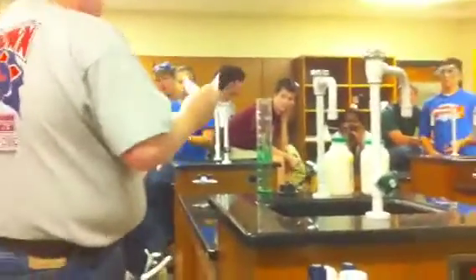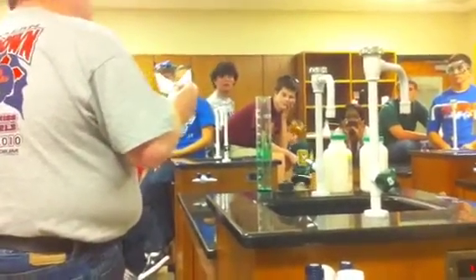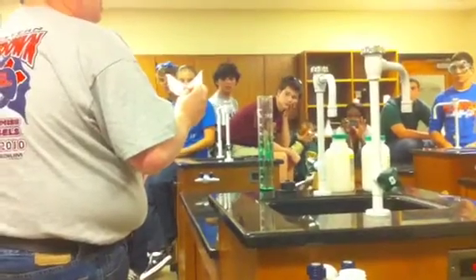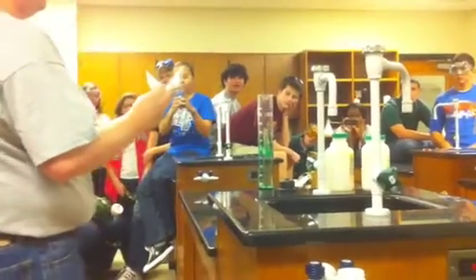We use 3% hydrogen peroxide for cuts — the bubbling you see is O₂ gas. We use 10% in this lab. For demos I use 30%, but thanks to my Hebrew boys and girls, we have 50%. Are you all ready?